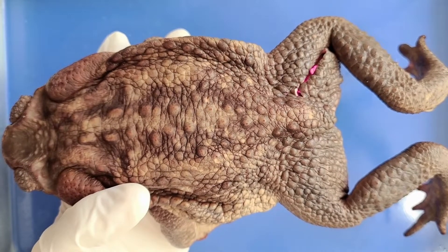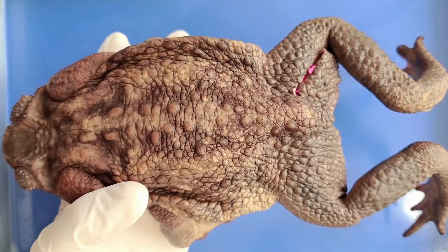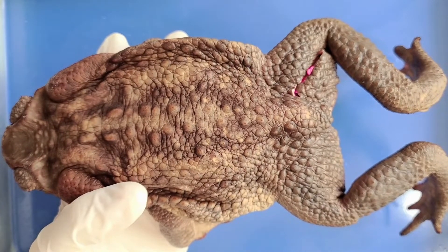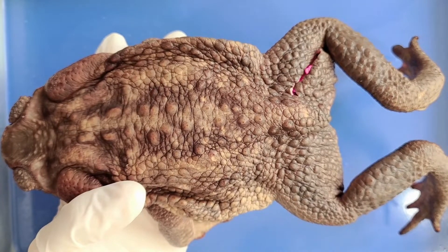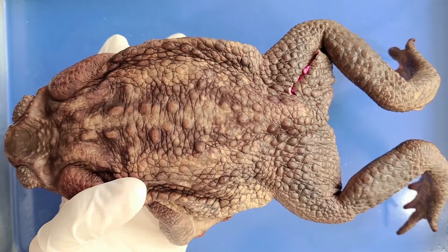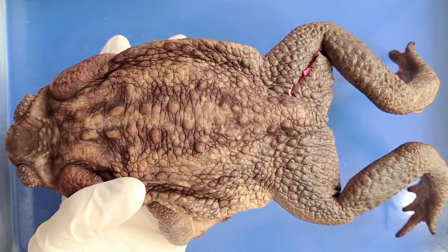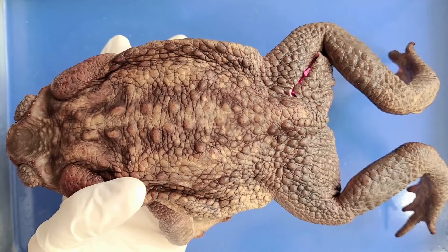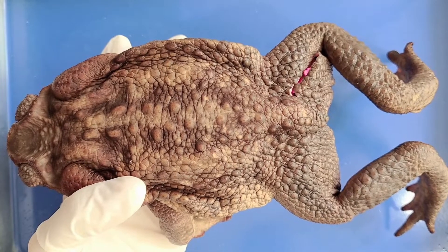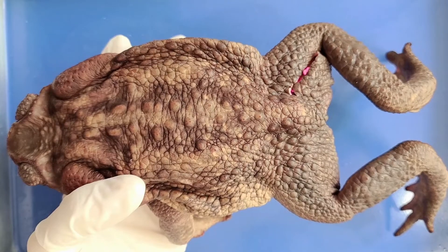First, let's take a look at the skin. In mammals like us, the skin mainly protects the body by shielding it from injury and keeping out germs. But in toads, the skin has a much more complex function — it also serves as a respiratory organ, absorbing oxygen and expelling carbon dioxide. They do supplement respiration with their lungs, though. Toads also absorb water through their skin, so they never drink water.